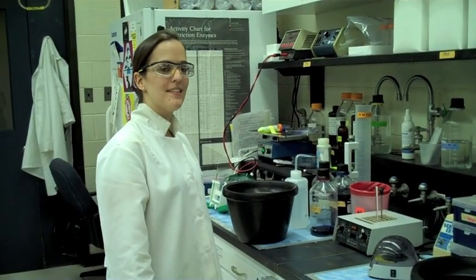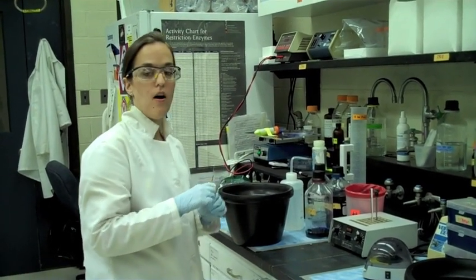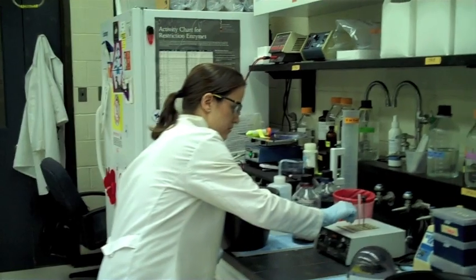Hi again. It's been 30 minutes and now we're going to put our cells with the DNA mixed together on a heat block at 42 degrees Celsius.